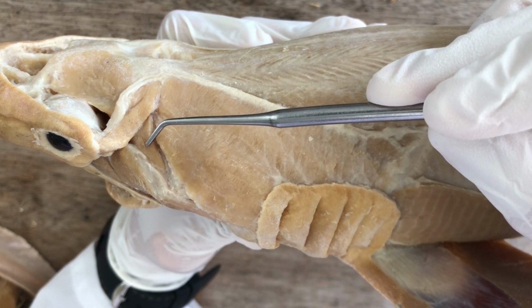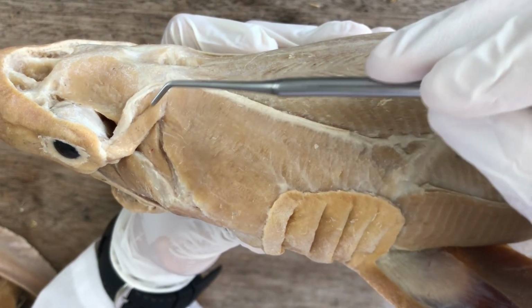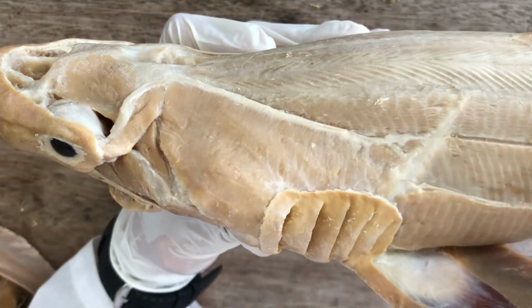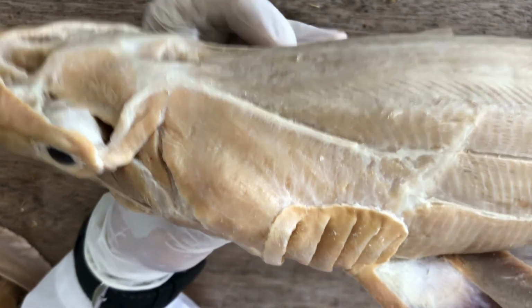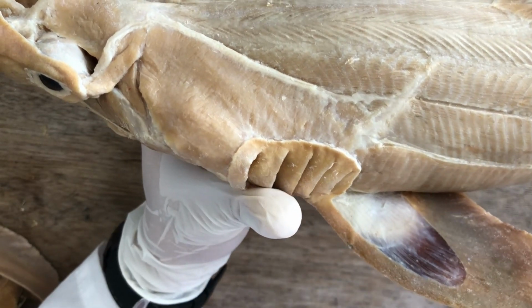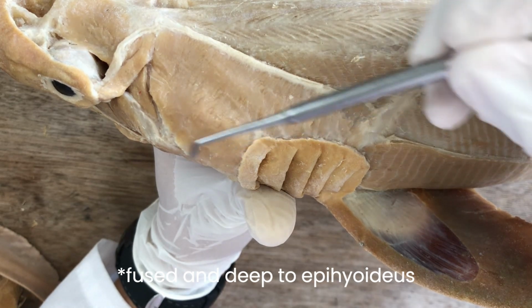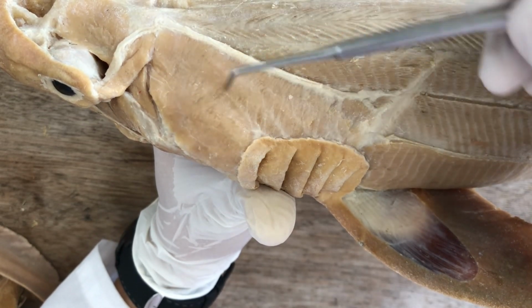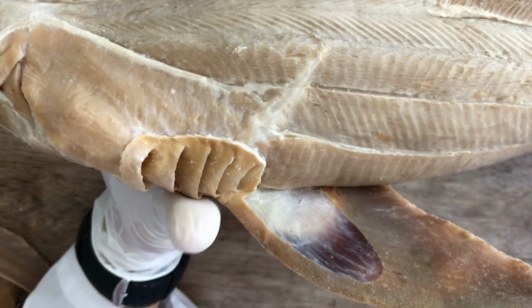That's right, that's craniomaxillaris. This one is levator maxillae superioris, a levator muscle. And then the second levator, hyoid levator, cannot be seen actually from our specimens. It's fused to the epihyoideus muscle, so you won't be able to identify it from our specimens.